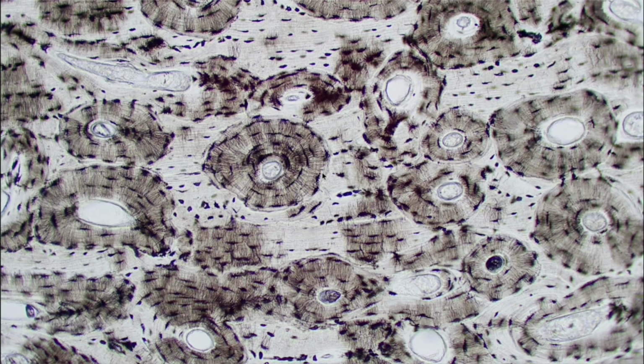Another helpful thing that people tell me and that I have started is that it looks like the trunk of a tree, right? So that's how we know that it's bone. We can see we got these rings that are kind of radiating from the center. So a lot of people think of this as a tree trunk, and that's a helpful way to help them remember that this is bone.